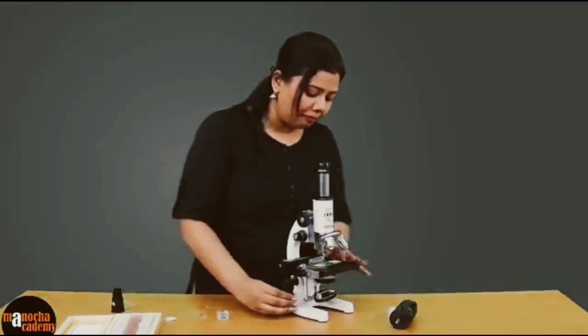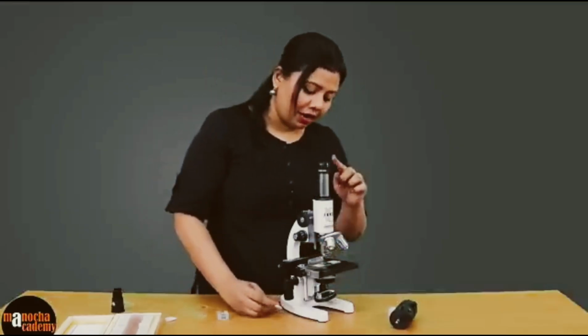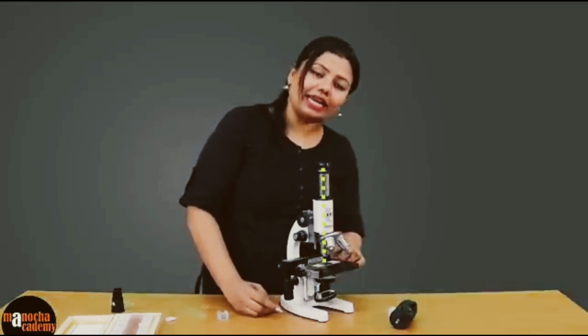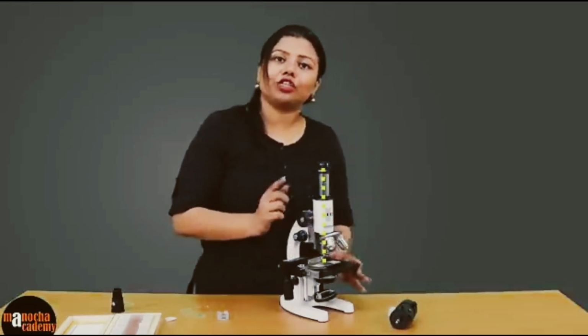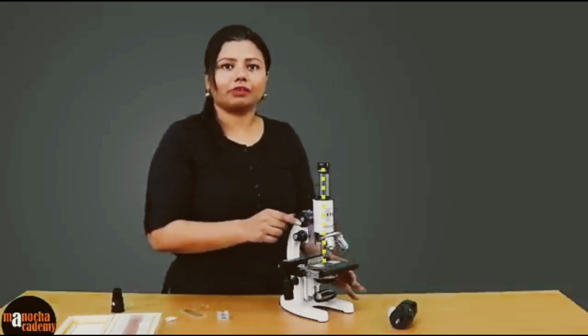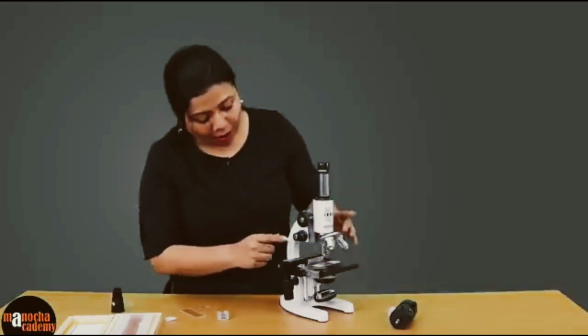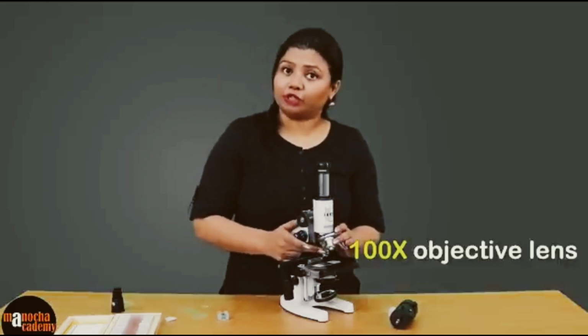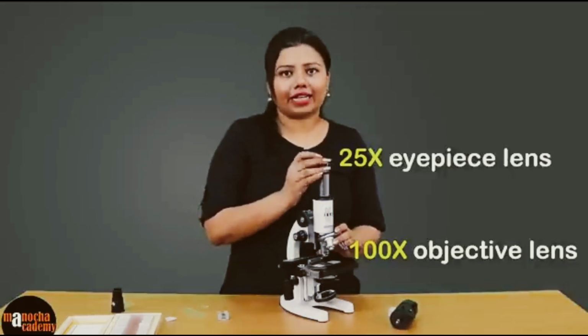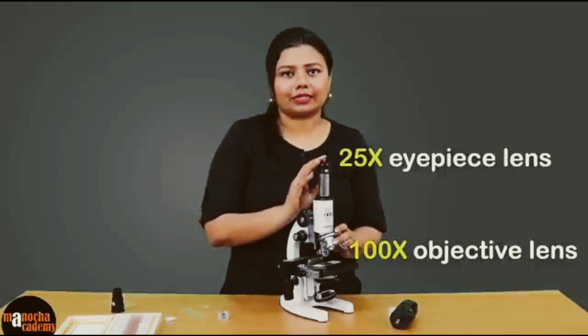Now once we have brought the slide and the specimen right in the same line as the lenses, we can start using the coarse adjustment screw to focus. Now at this point of time, I am using 100x for the objective lens and 25x for the eyepiece lens.